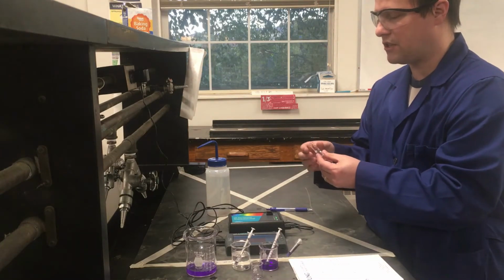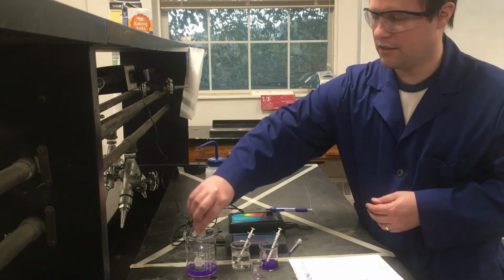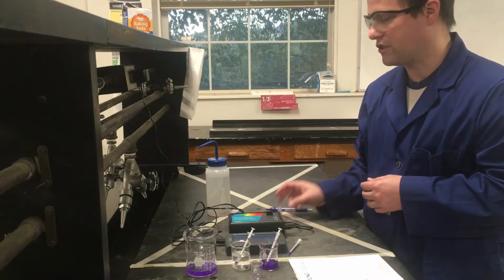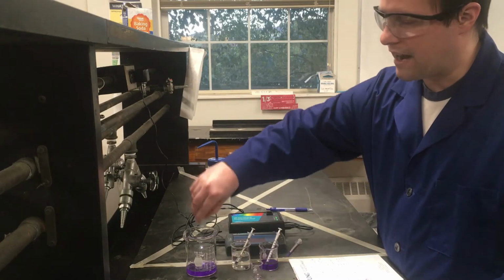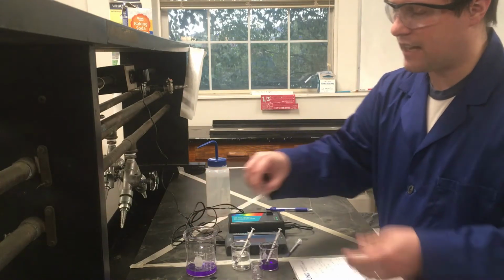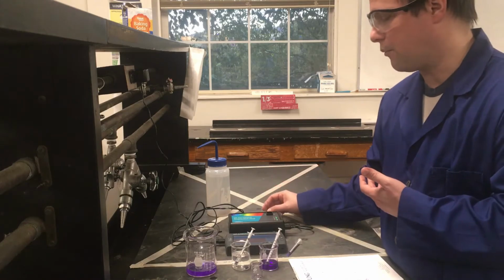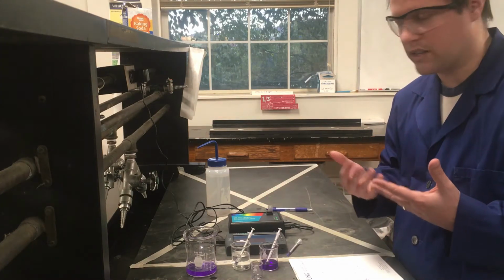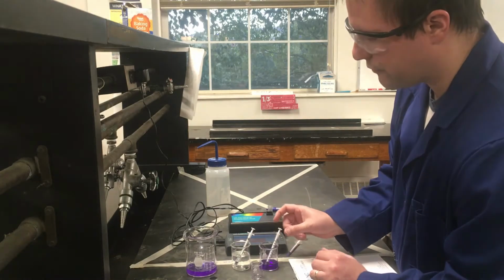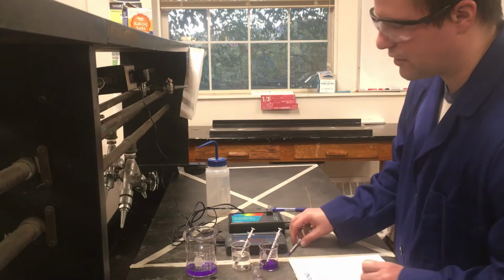But since we don't have an infinite number of cuvettes and supplies, we are just going to reuse the same one, just rinsing it out each time. Ideally, I would like to get all the water out of this, because any water that's still left in the cuvette might dilute whatever sample I put in there next, so that we get a lower absorbance than maybe what we expect. Hopefully we won't see too many side effects from that as we go. We shouldn't see anything too terrible.